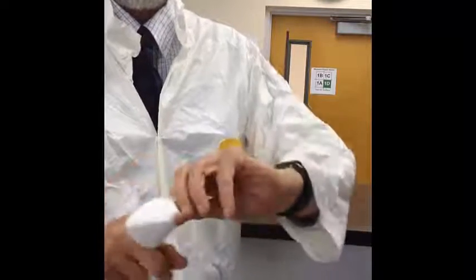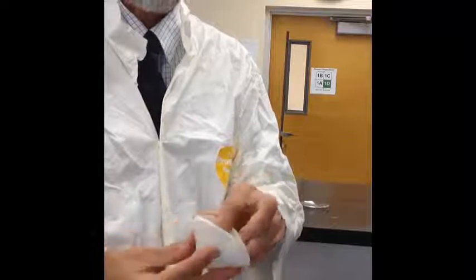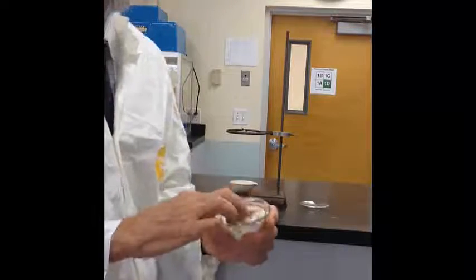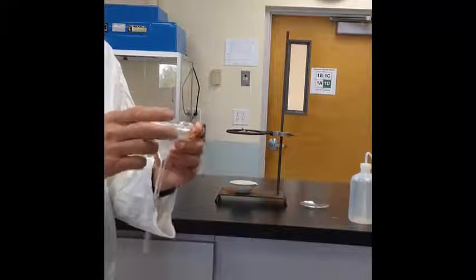If we fold it instead so that there are 2 thicknesses on either side, it creates an opening in the bottom and the sand will wash out. We want to avoid that. Make sure we fold the paper properly. The paper is placed into the filter funnel. It may be dampened with a few drops of water from a wash bottle, and that will cause the paper to stick, which will create a nice filter funnel for us to put the salt and sand mixture into.